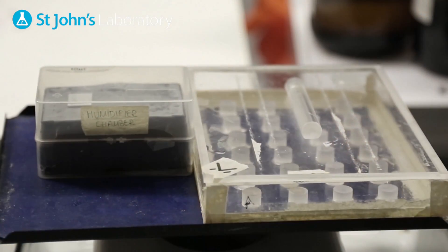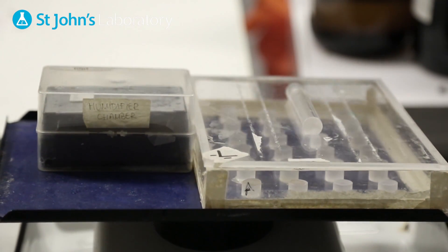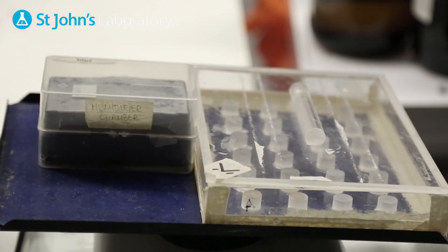The cells are faced down on the blocking solution and incubated for 1 hour and care should be taken to prevent air bubbles forming under the surface.